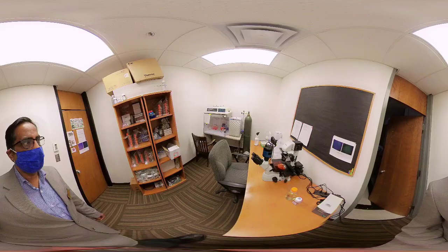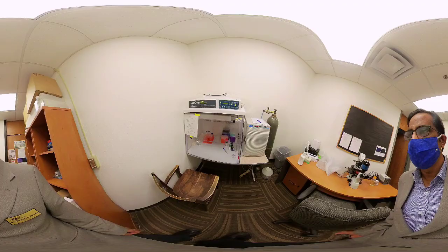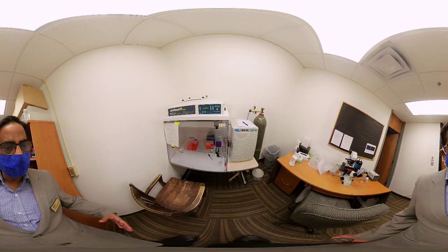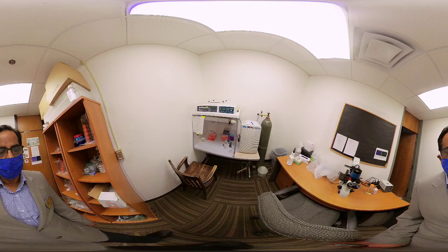Here we have a laminar flow air clean system that we use for cell culture, and we also have a carbon dioxide incubator and a carbon dioxide container. This cell culture setup is newly developed and still developing — we plan to expand it further. We use it almost every day, and the cells are currently in the incubator.